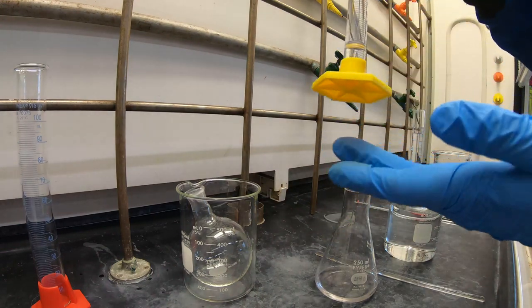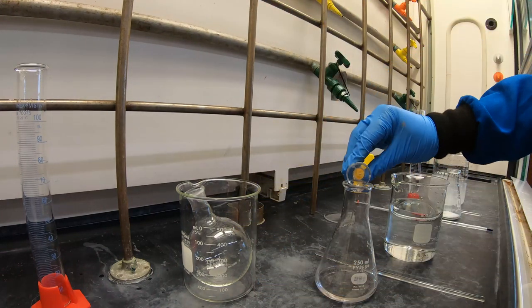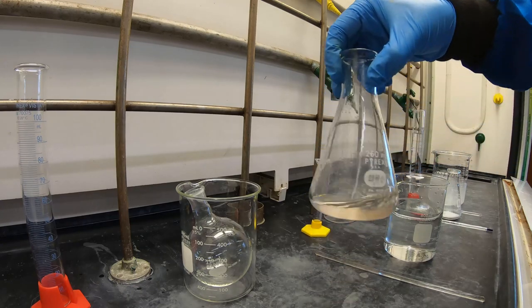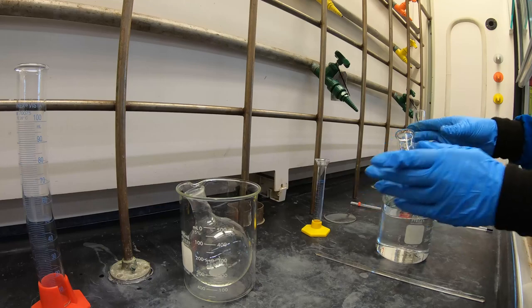Now add 0.033 moles of alpha chloroacetyl chloride. The order of this addition is important. Now add your flask to a hot tap water bath to warm your solution.